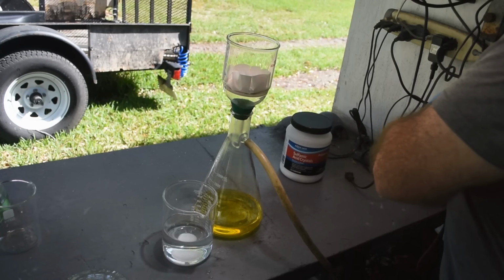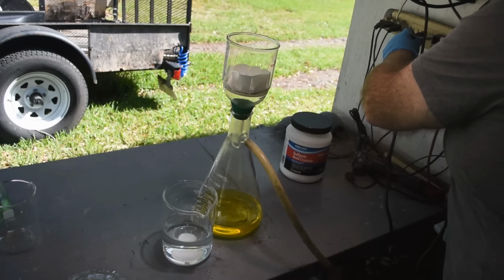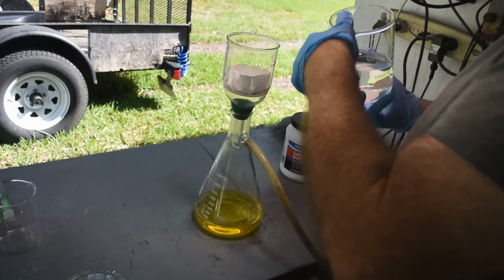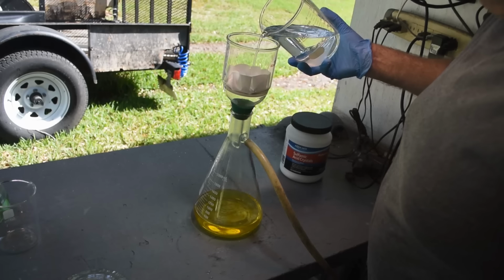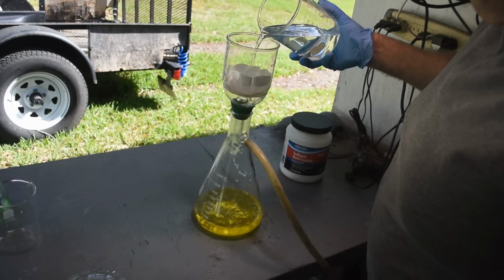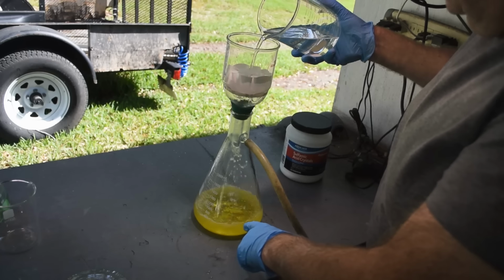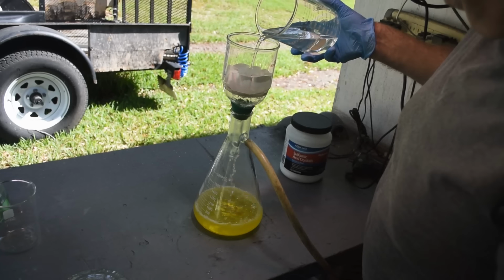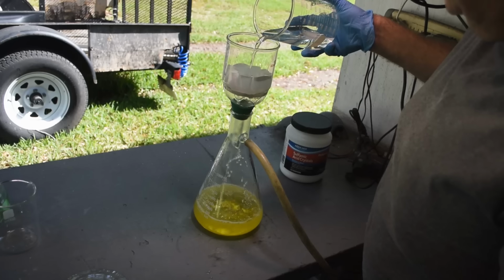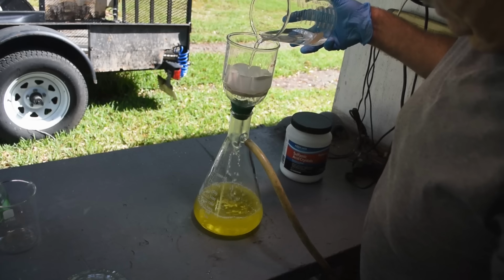So I'm explaining that I mixed up a lot of the sulfamic acid solution. I wanted to make sure this was thoroughly denoxed. Going to pull it through the filter with the vacuum. And as you can see, or maybe you can't see, but there's a lot of fizzing going on in the flask down there as it hits the aqua regia with the excess nitric acid in it, and it is doing a good job of denoxing that liquid.